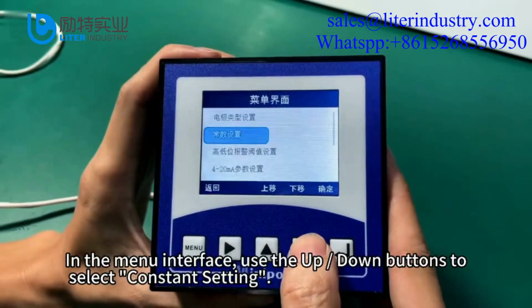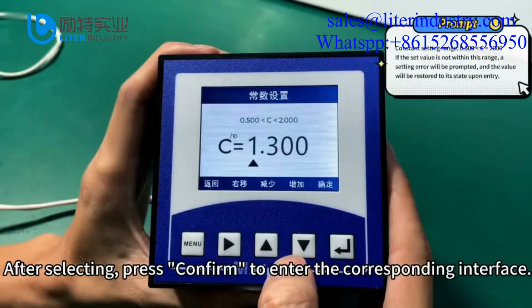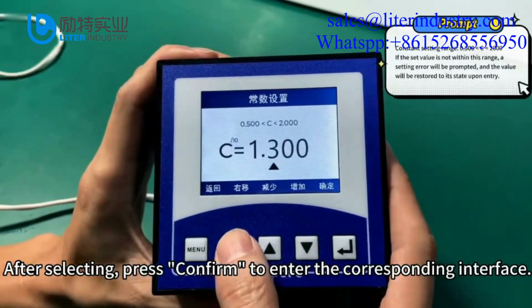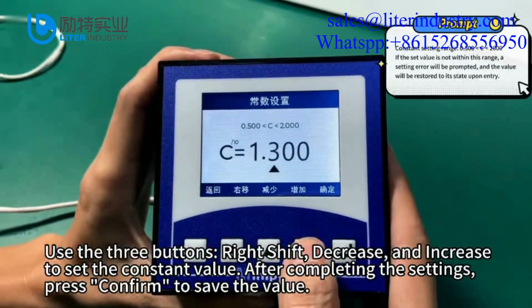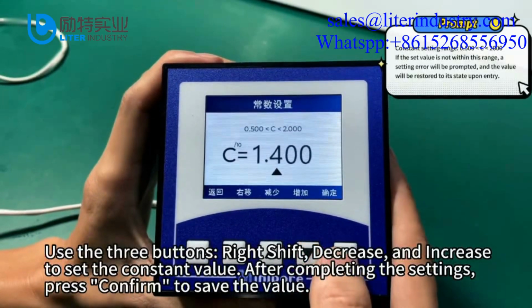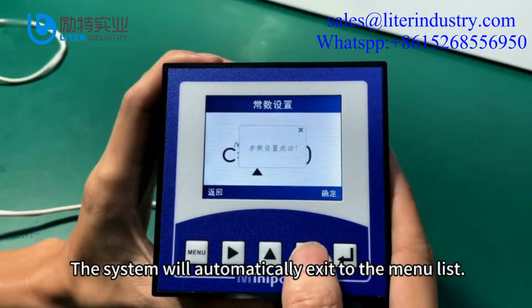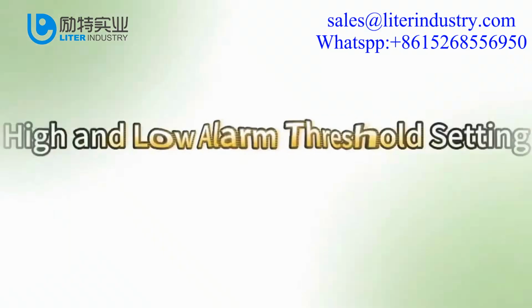In the menu interface, use the up-down buttons to select constant setting. After selecting, press confirm to enter the corresponding interface. Use the three buttons, right shift, decrease, and increase to set the constant value. After completing the settings, press confirm to save the value. The system will automatically exit to the menu list.